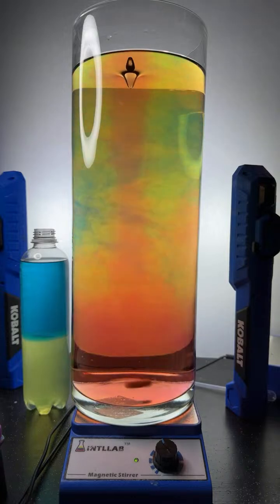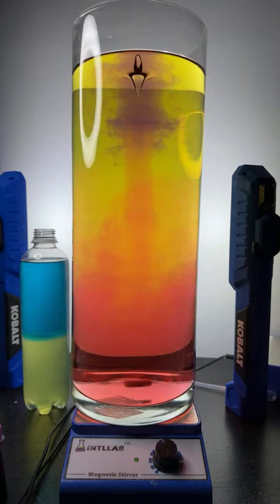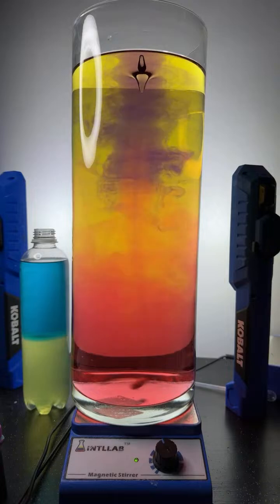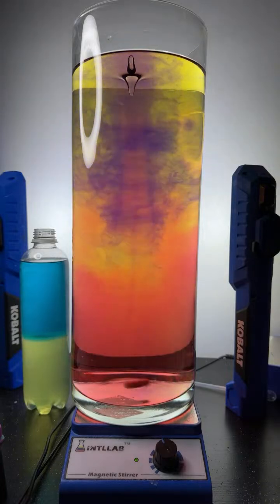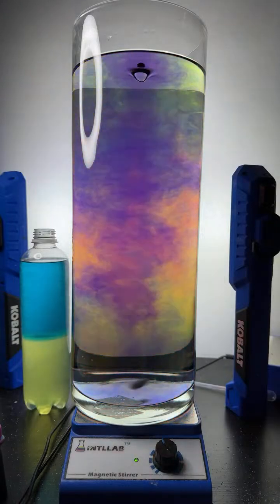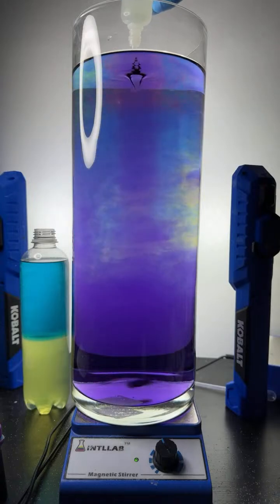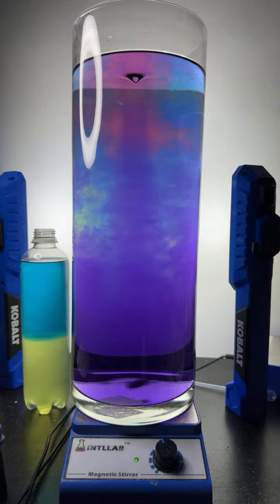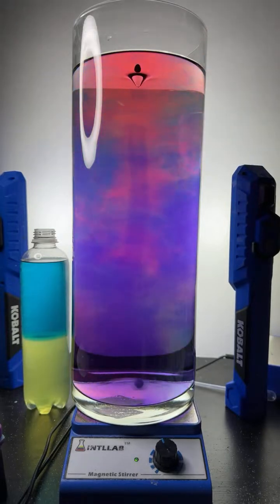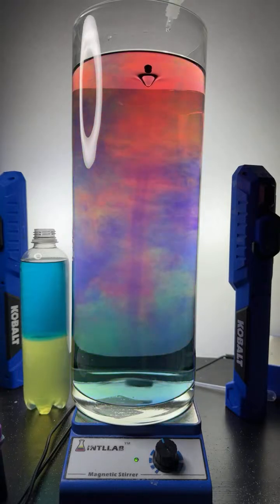All right, let's keep adding some sodium hydroxide base here. Boop, boop, boop, boop. I agree, Shrey. It's just really cool. Here, let me get everything red. Let me get the pH pretty low. I'm going to go ahead and add a bunch of acid. The acid I'm adding is hydrochloric acid, which is the same acid that's found in your stomach. It's just that this stuff is like 100 to 1,000 times more concentrated. What I'm going to do here after this homogenizes to a red color, come on.